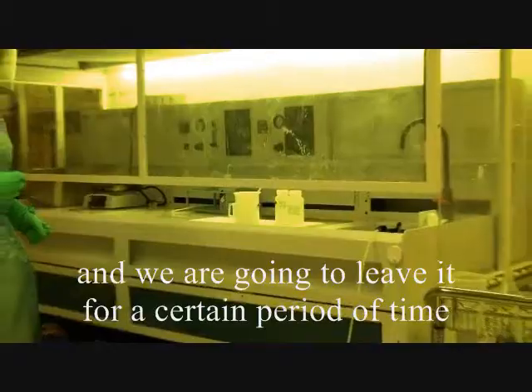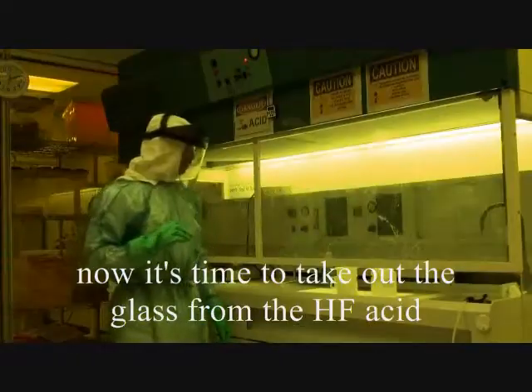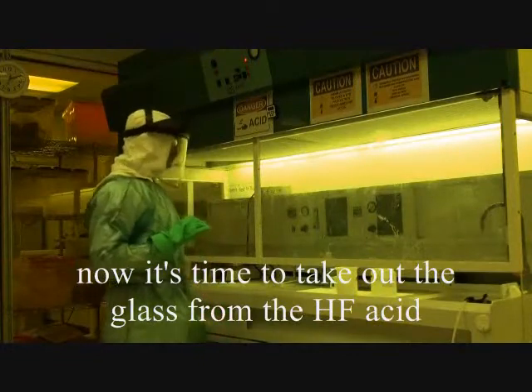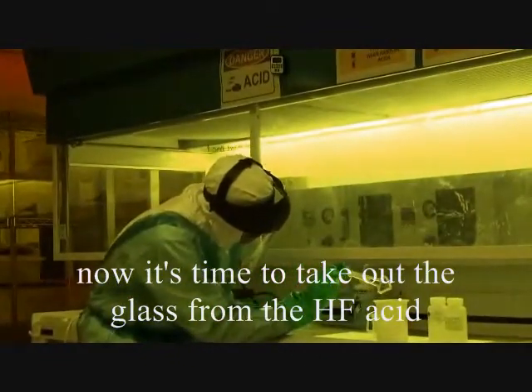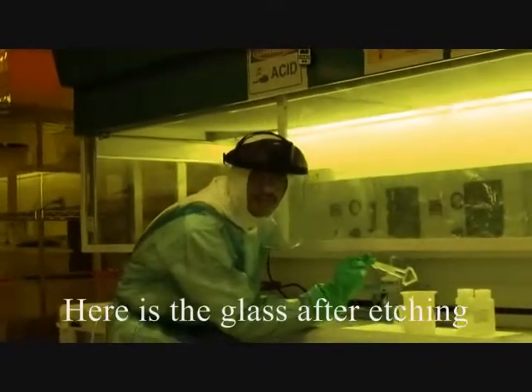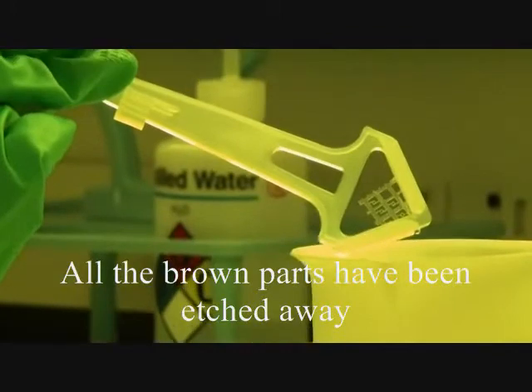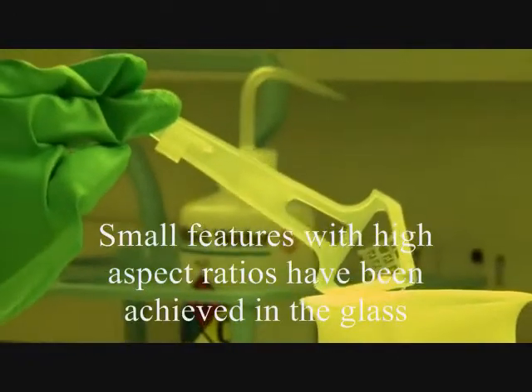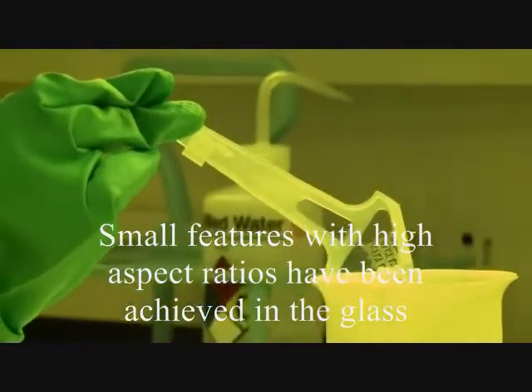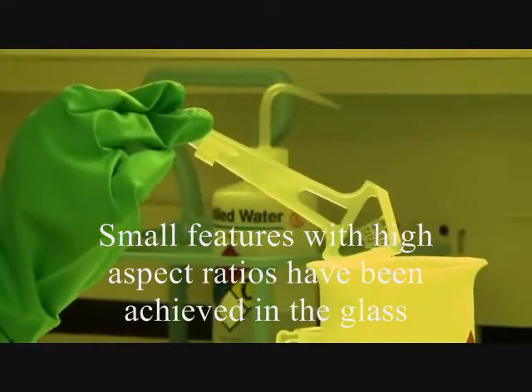It has to be done under a fume hood, and we are going to leave it for a certain amount of time. Okay, now it is time to take out the piece from the acid. All the brown part has been etched away. The small features — the high aspect ratio features — have been etched into the glass.